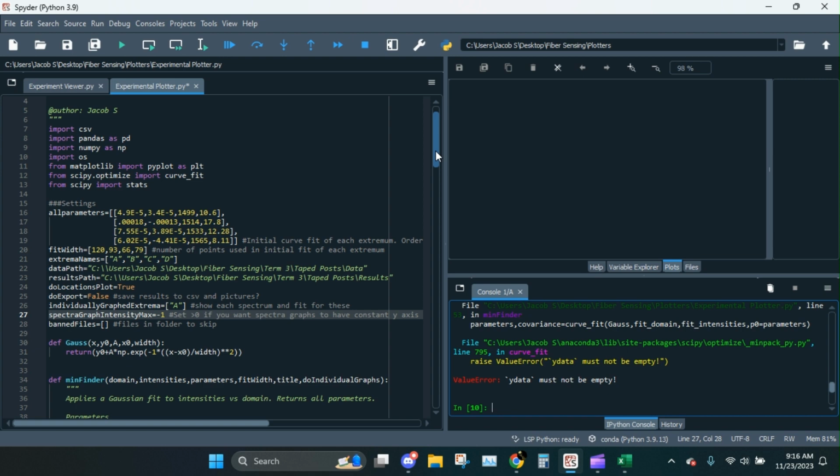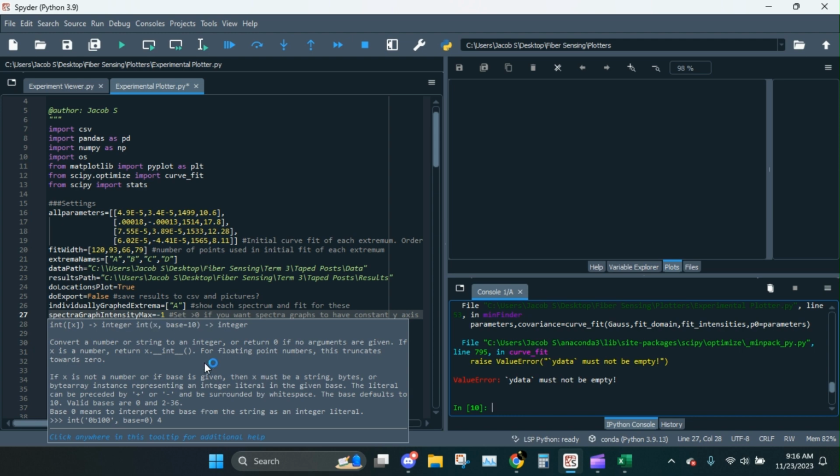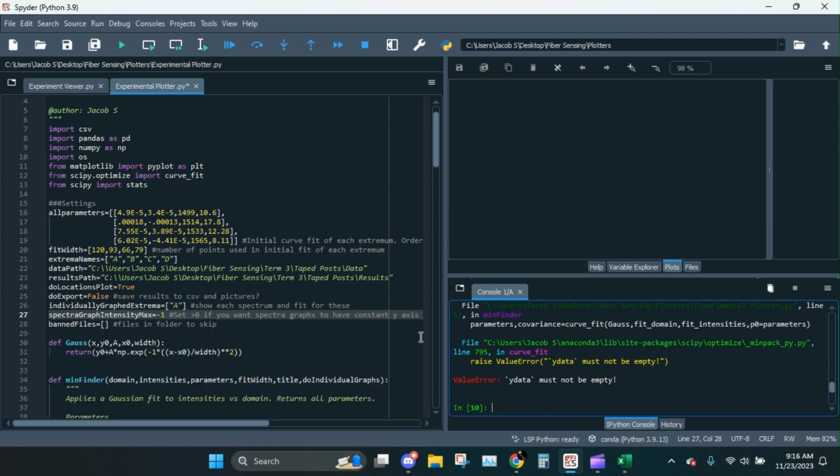Okay, so I'm back after I had to leave for a while. One thing I did change is about this spectrograph intensity max. Previously I just had it as that's how you set the y max for all the spectrographs, and it was always a constant. But as you saw, sometimes it would go over that. So what you could do now is set this to a negative number, and then that'll allow it to just set the y-axis dynamically. So I'm going to leave it like that for now.